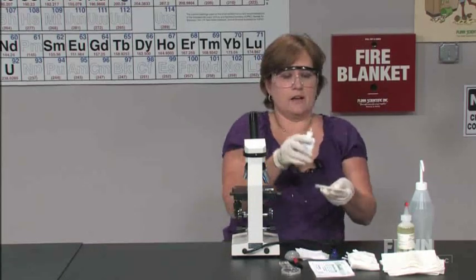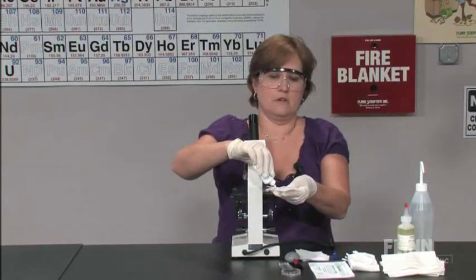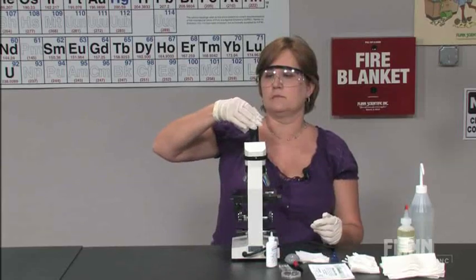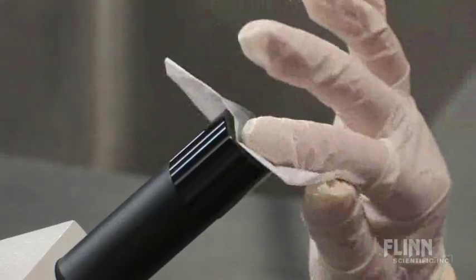Then, you're going to wet a piece of lens paper, and from the bottom to the top, wipe the ocular.